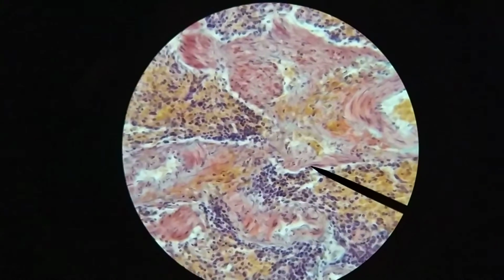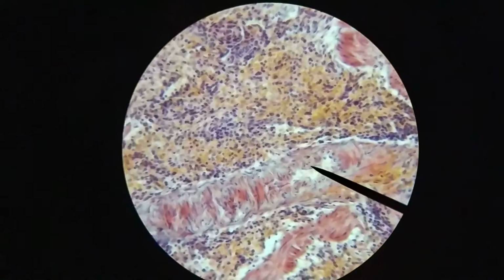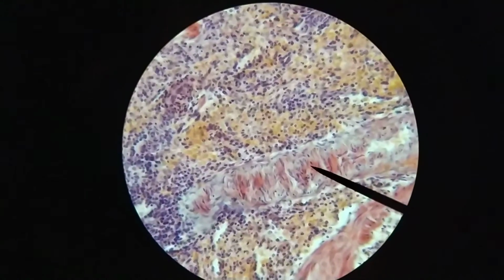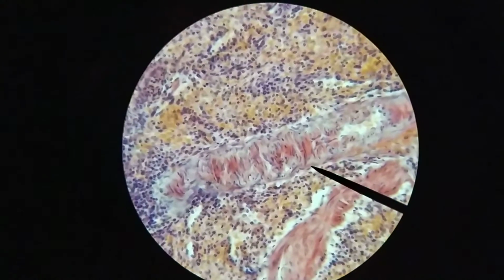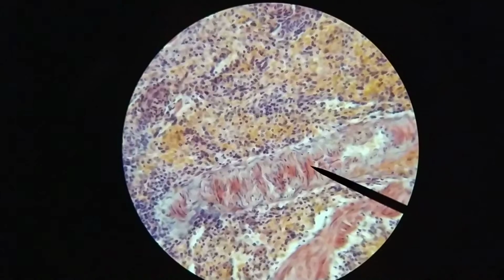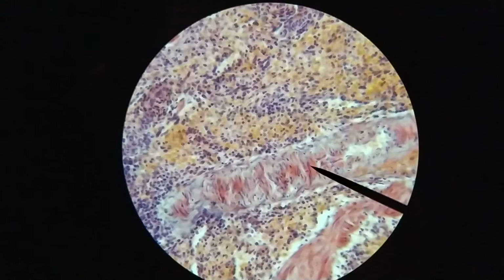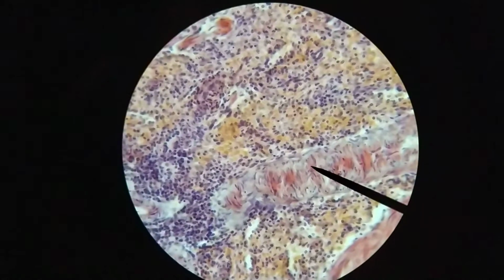The branch point going off in this direction, you can actually see right here a longitudinal section through an arteriole passing away from it. And some of these cells that you can see here going across, up and down on this slide, for example in here, that's smooth muscle. Because we're looking at a longitudinal section through this blood vessel, this is the outer tunica media of that arteriole. The smooth muscle is going to look like a longitudinal section. And what you're seeing is just the edge of that tunica media here.